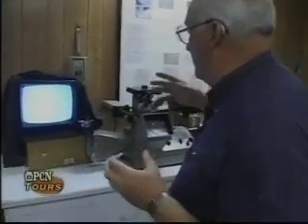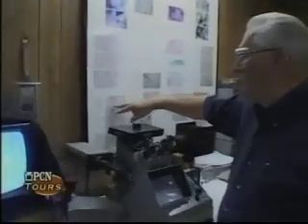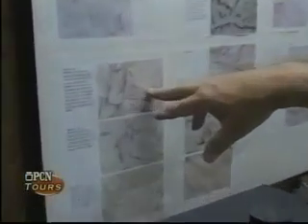The reason we add those materials to the metal before we cast it, and what you saw on the sample on the computer before we came into the lab, was so that we can take the metal, which in its natural form would have a linear formation as you see here, and by making the additions that we do to the metal, we get a modified version as you see here. And that's what we're trying to achieve, that we get the optimum as far as mechanical properties are concerned, because of the fact that strength plays a big role in how the end result of the product is used, and that strength has to be assured.